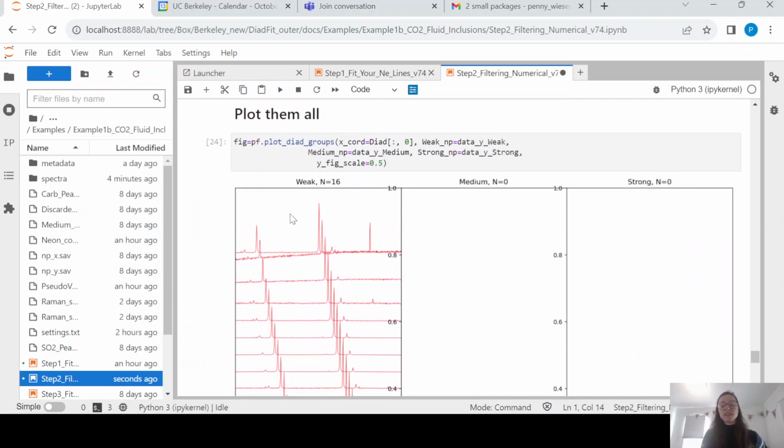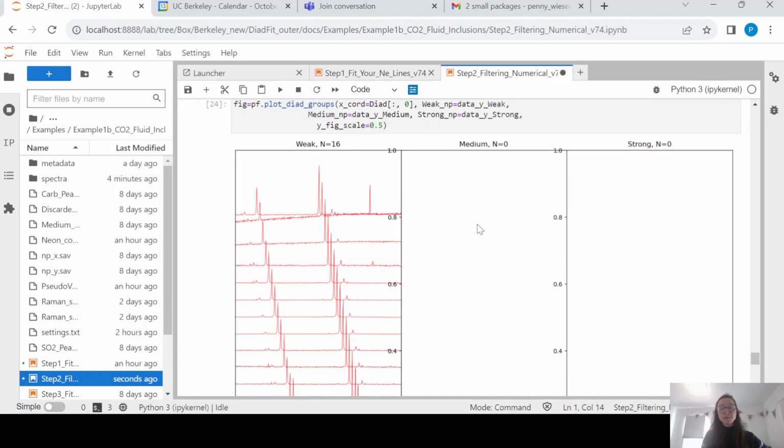So there are some other examples where you see that the filtering is more significant. For a lot of situations, you're just going to be using one group. You might have melt inclusion vapor bubbles, all of which are going to be weak. You're not going to need to do these medium and strong steps. You might have just super dense fluid inclusions from xenoliths, in which case they would all probably be in that medium or in that strong category.